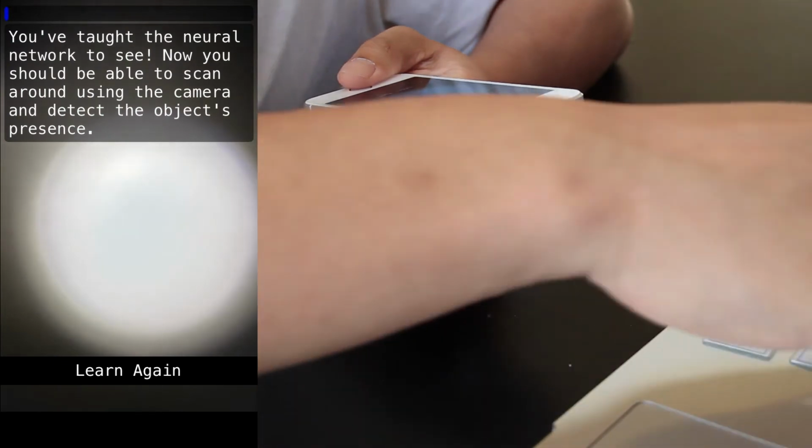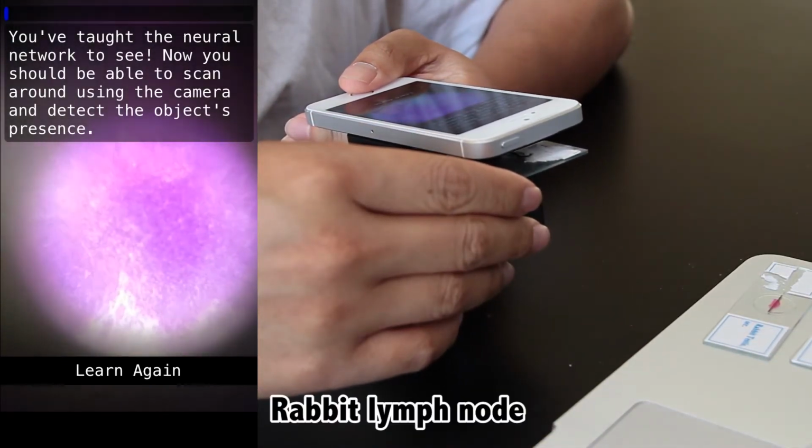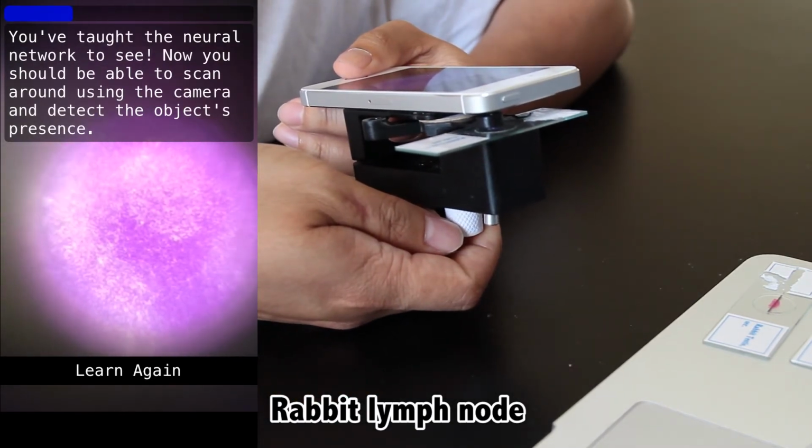Now we're going to try showing it the testing set of the sections that we taught the algorithm isn't frog liver. This is just as important, but luckily it's very confident when it isn't looking at the frog liver we showed it before, showing roughly 0% confidence.